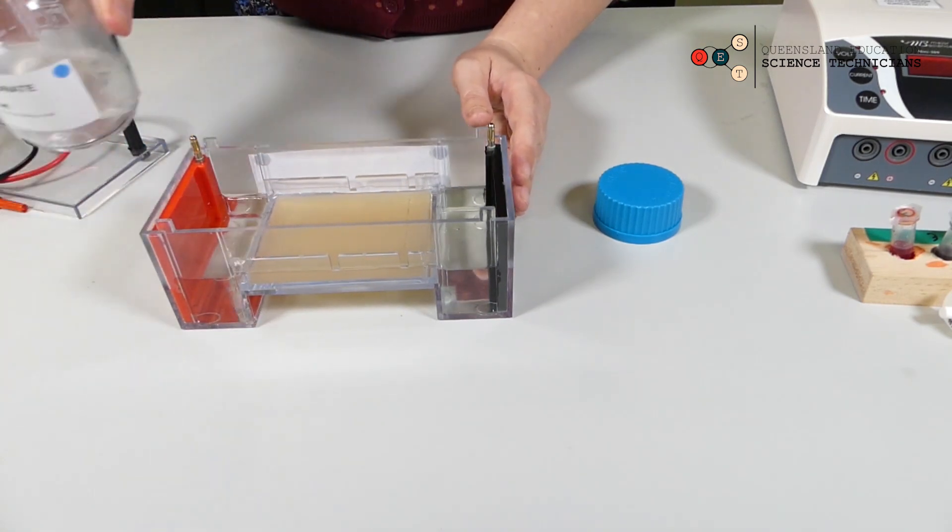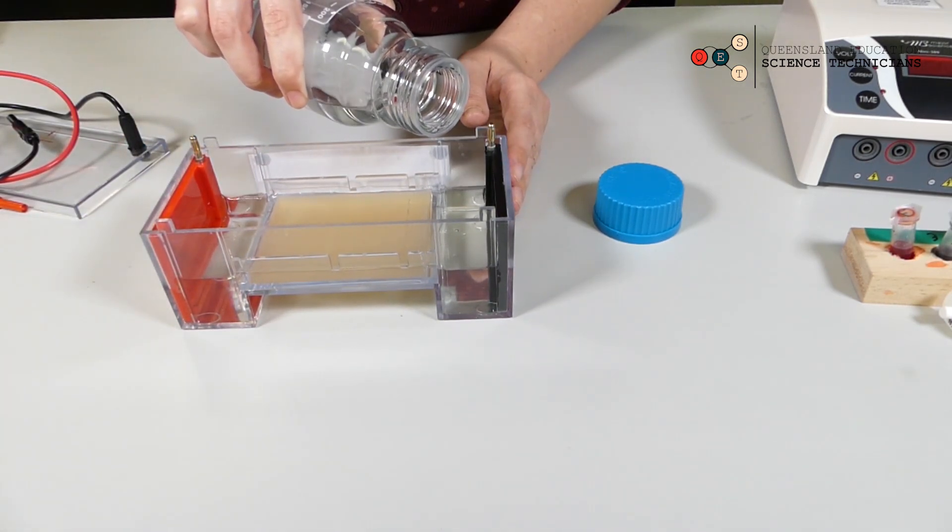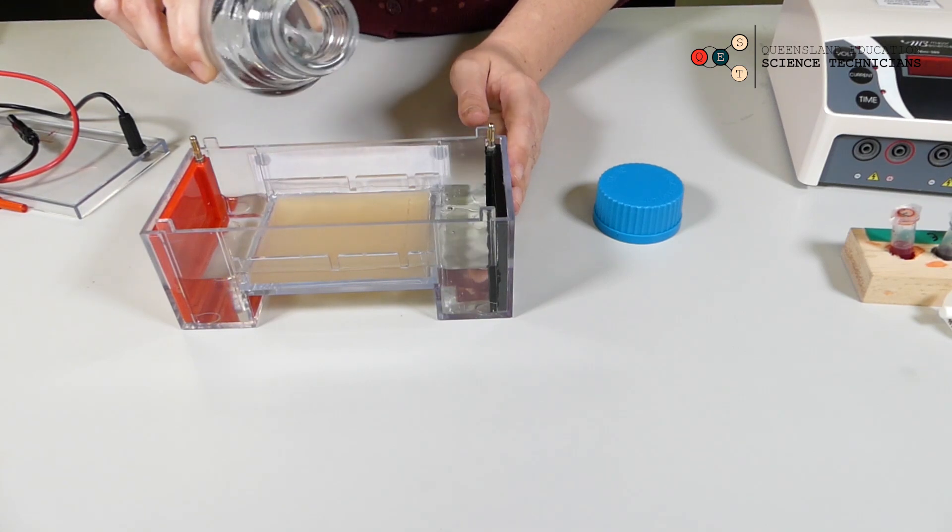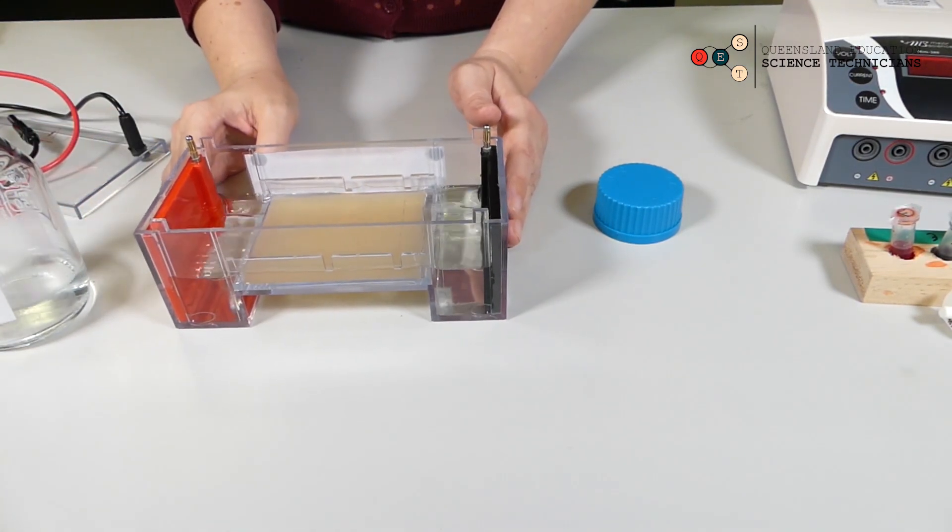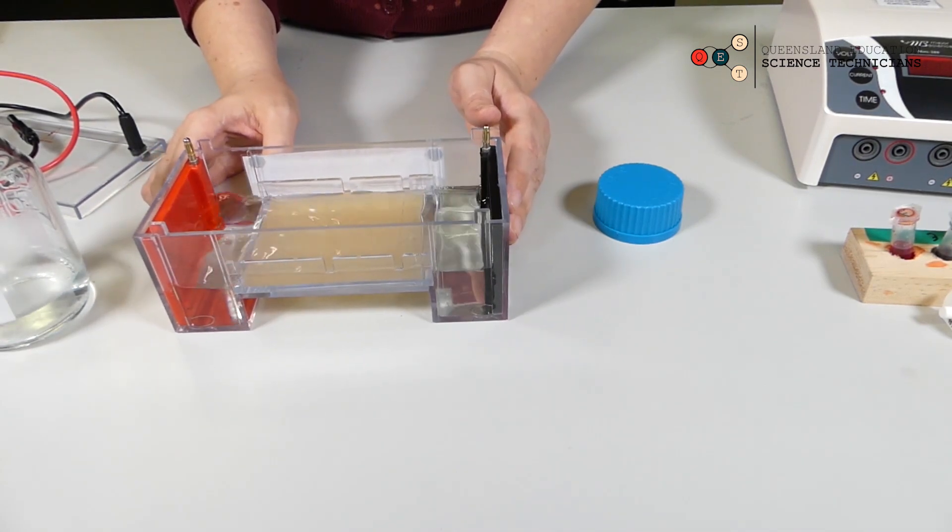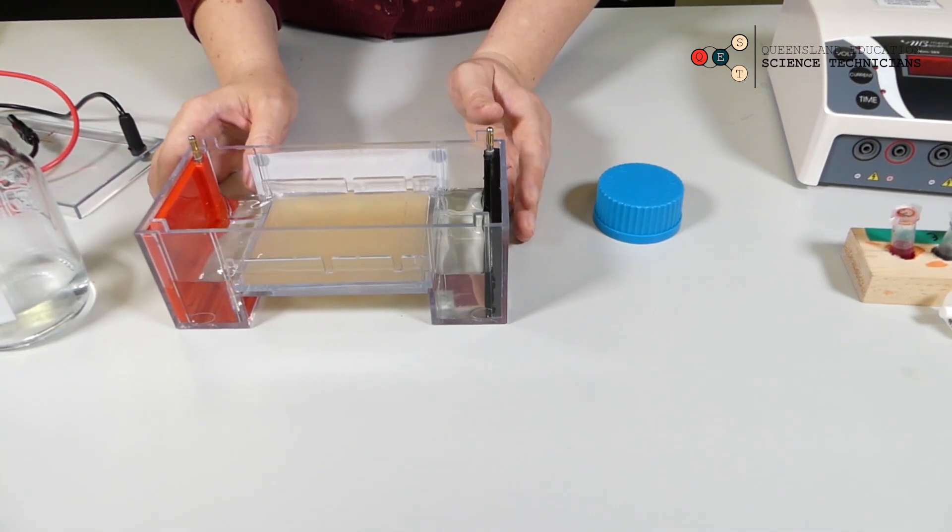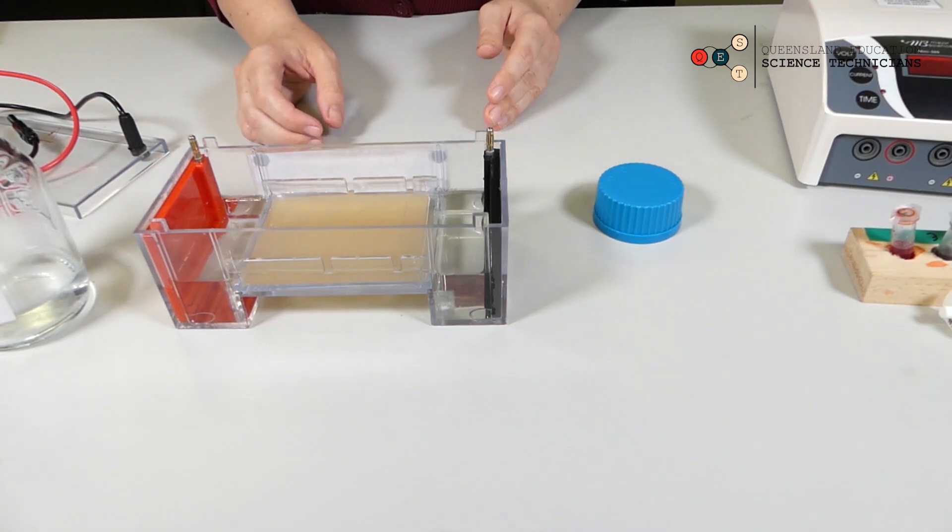Get a little wiggle, just make sure there's no bubbles inside the wells in your gel.